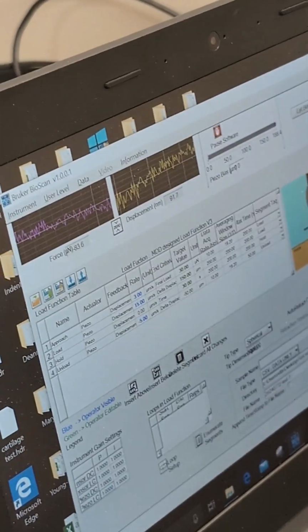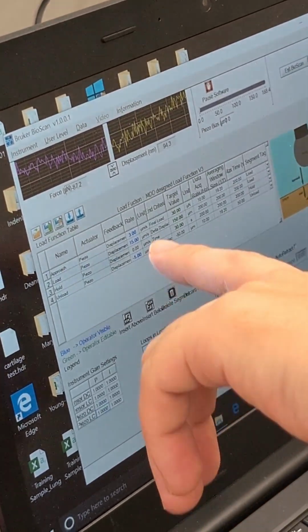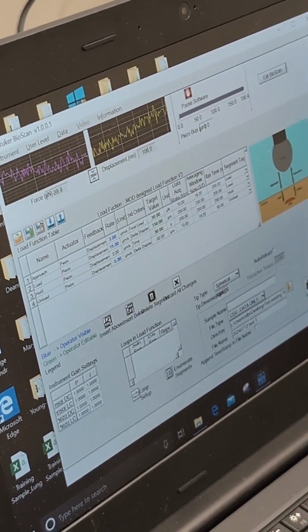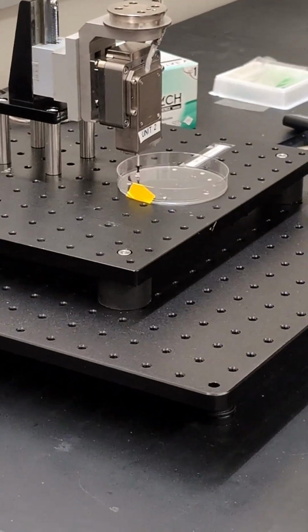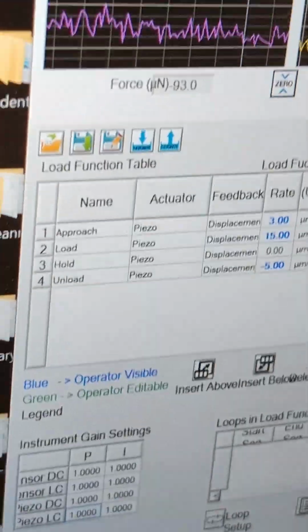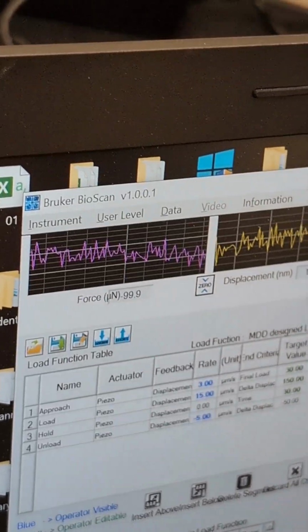Why do you pick -100? Because I do give it a little bit of distance, to allow the probe to go down. Again, it's this nail versus hammer thing: you can't just have the hammer already on the nail to push it down. You generally want to have a little bit of movement space, so that when the probe hits the gel, it's like pushing on it. It's perfect now. It's right at 100.